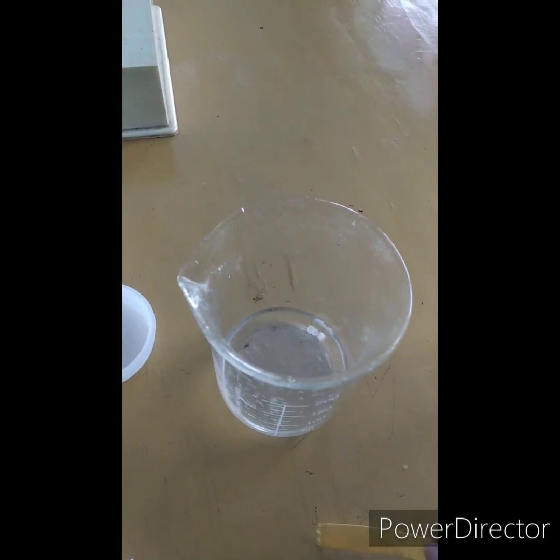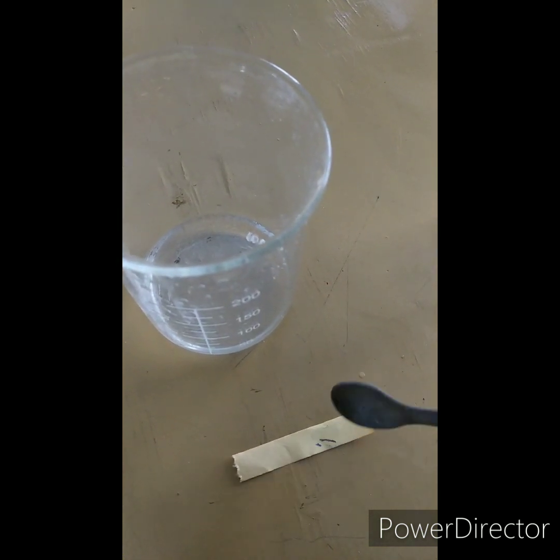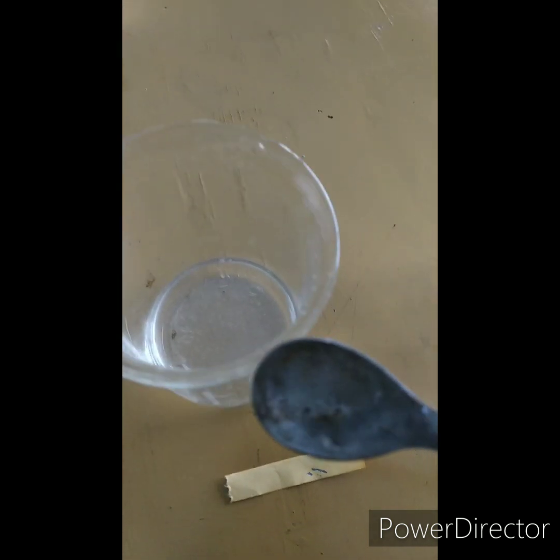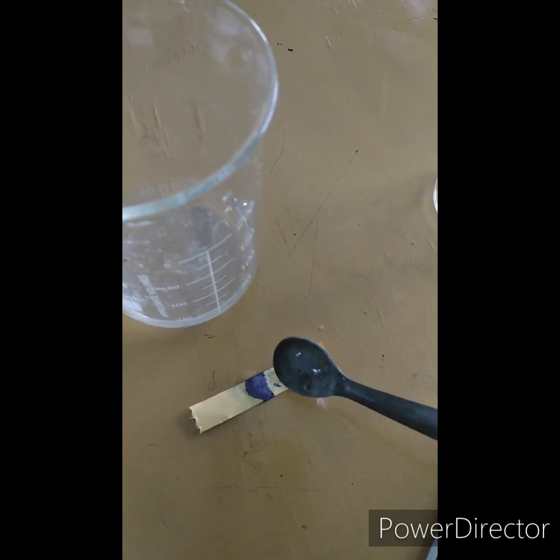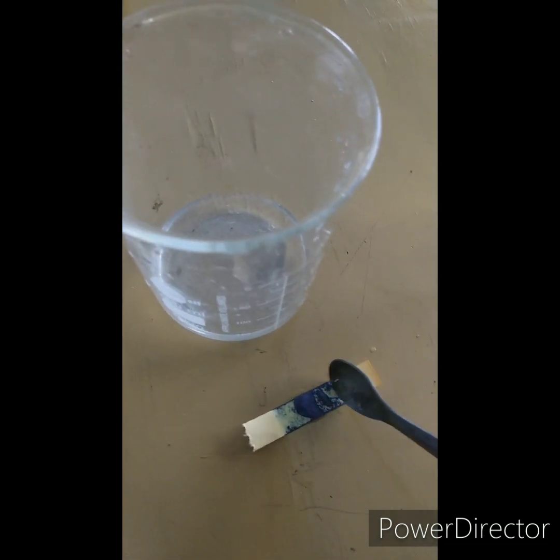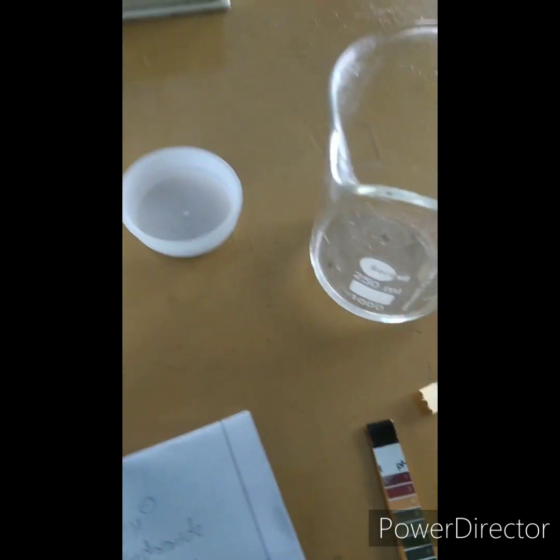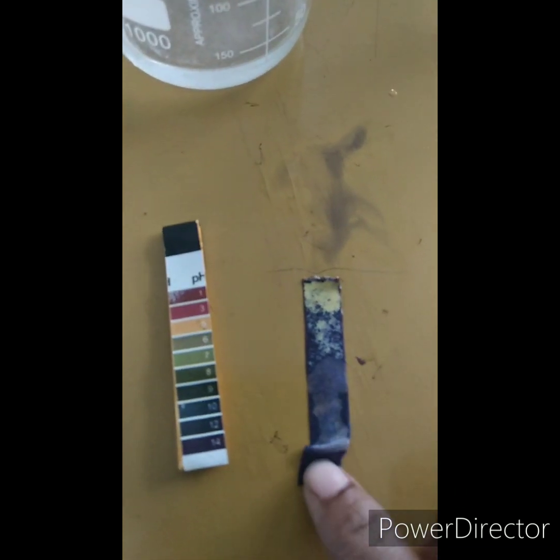Now from the universal pH indicator, I have taken one strip. I'll take a little bit of the solution and dip the strip in. You can see the color is blue. Now I'm taking the sodium hydroxide solution — let's see the universal pH paper changing its color. Sodium hydroxide is highly basic, and you can match its color.